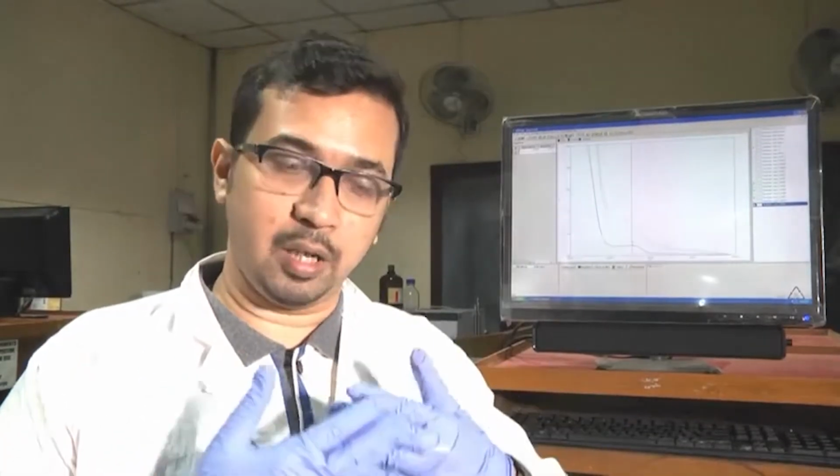Because the same fundamental principle applies. When protein is denaturated, the structure breaks, it unfolds, the tryptophan residue present within the core of the protein is being exposed within the solution, thereby more and more tryptophan is exposed in the solution, and that is why the absorbance increases. Now, while doing the experiment, one thing we have to note down here, which you should follow, is that in order to obtain a proper peak out here, like the peak, shoulder is coming, no proper peak is coming, but you have to do a control subtraction or a blank subtraction.